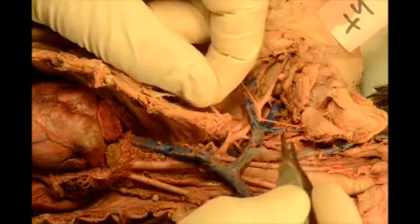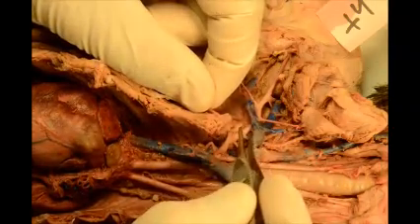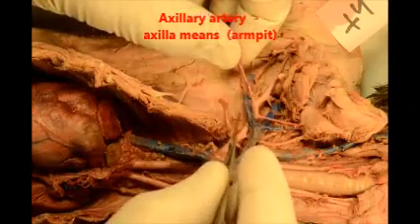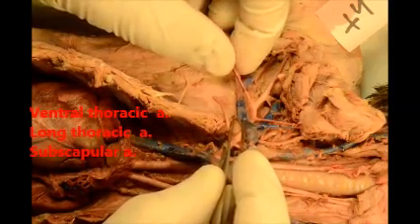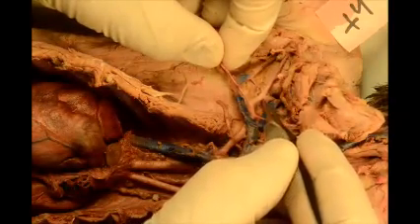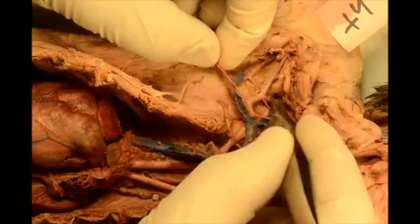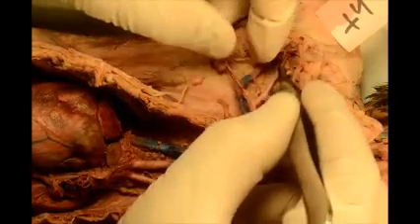As we get past the T, which is thyrocervical, the vessel is now called the axillary. The axillary gives rise to three other branches, and those you can remember by VLS. Here you can see them: V is ventral thoracic, L is long thoracic, and S is subscapular, which is here. After you get past the subscapular, it's no longer axillary but now it's called the brachial.